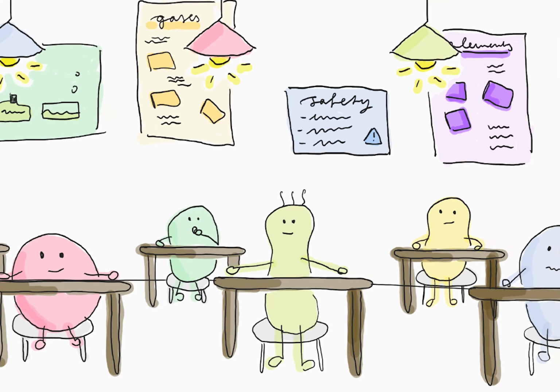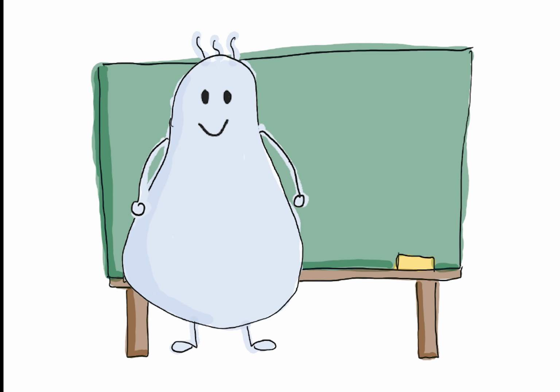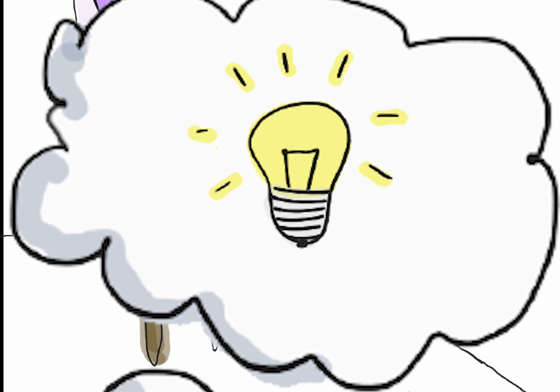Let's be honest, security briefings at school are boring. Max finds himself in the same situation you probably all know yourself. During the lesson, he is daydreaming about what could happen if you really disobey the safety rules.